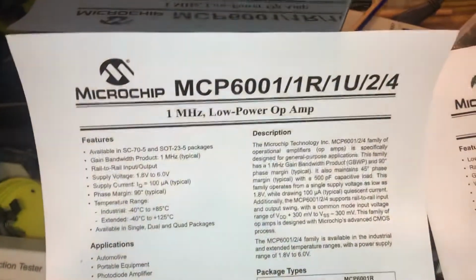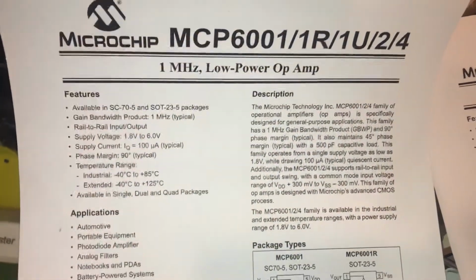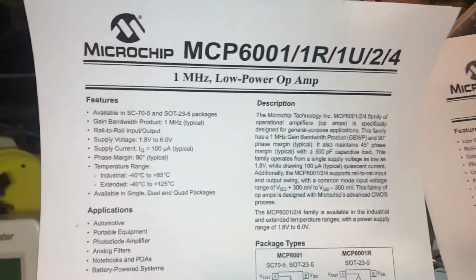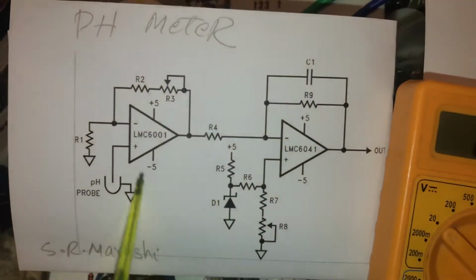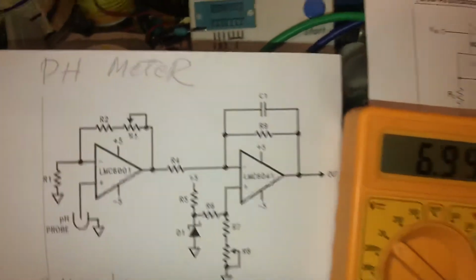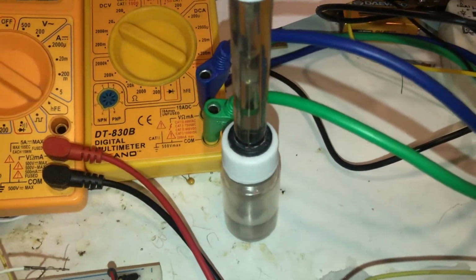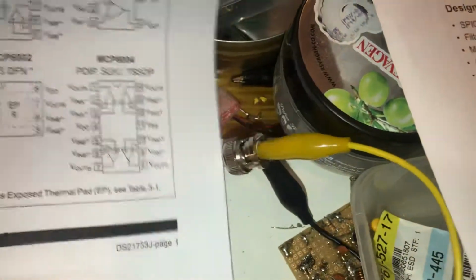As you can see, MCP6001, it is nothing special. This one is a rail-to-rail 1 MHz operational amplifier. This part is used for the electrical connection like this. The electrode output is BNC and it is connected over an alligator clip.